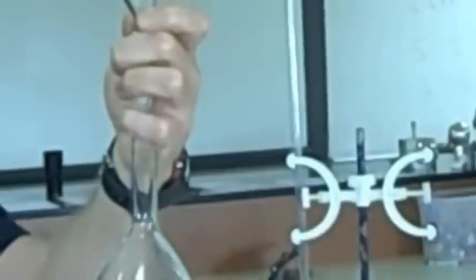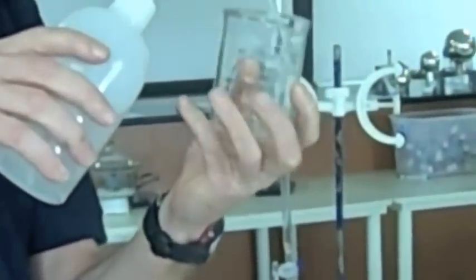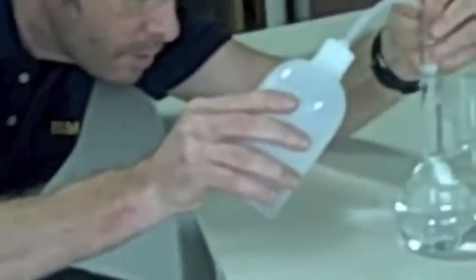Like so. And again we're going to rinse — remember, there's some oxalic acid solution in here, so we have to wash our solution into the flask. We've got everything out of there, just rinse that a little bit. Now we're going to make up to the mark. You'll see there's a graduation mark here — the bottom of our meniscus needs to be right on that graduation mark. You might need to take out a pasteur pipette to help you do that, because if you go past, you've completely messed up.